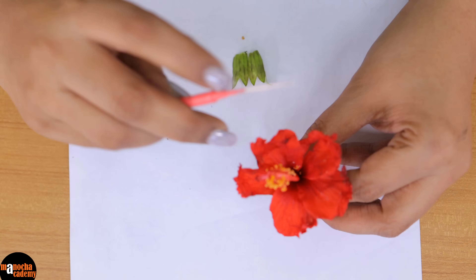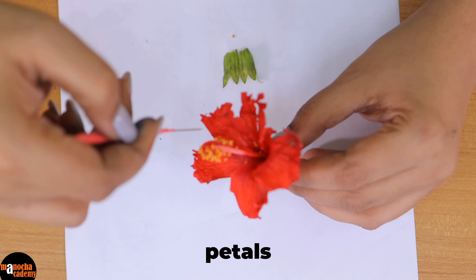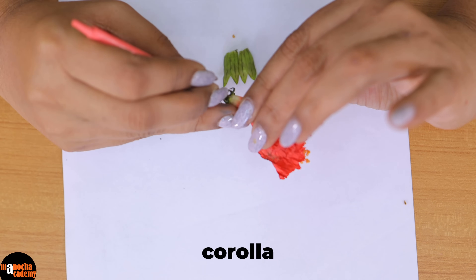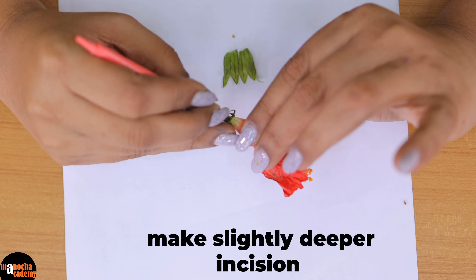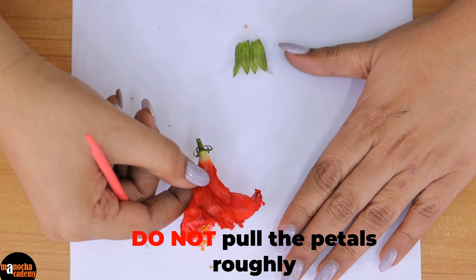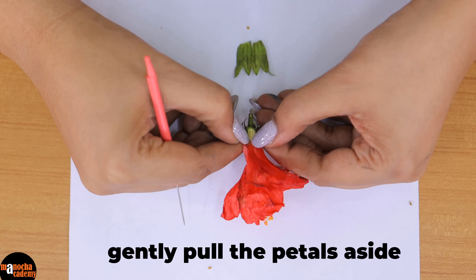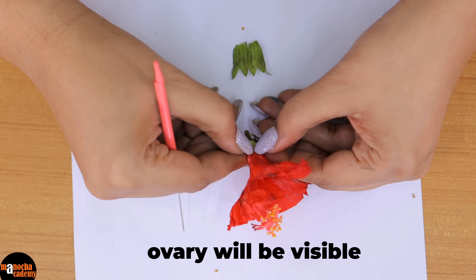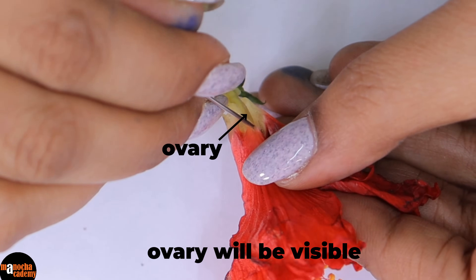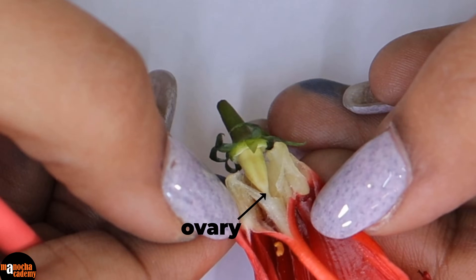The next whorl of the flower are the petals. You can see there are five petals. I want to take out these petals — the entire whorl of petals which is known as corolla. For that again I will hold the flower at the petal and give a slightly deeper incision at the lower end. You have to be careful that you do not pull or tug these petals too much. You will just have to pull the petals so that you can see the ovary inside. See, we can see the ovary inside — this is the ovary.